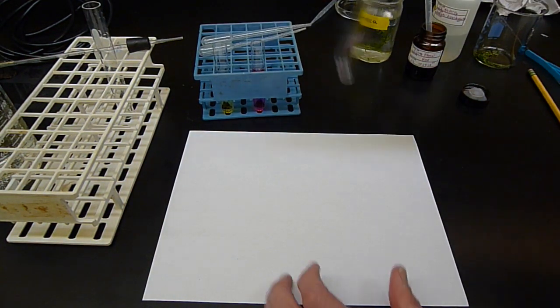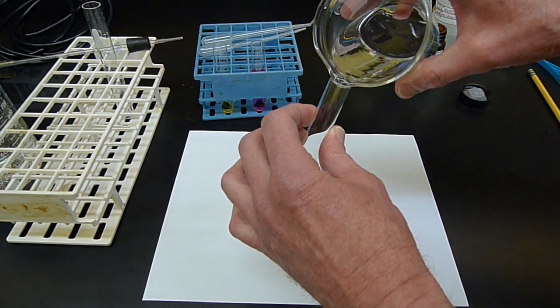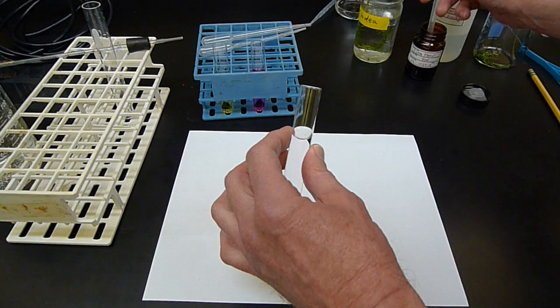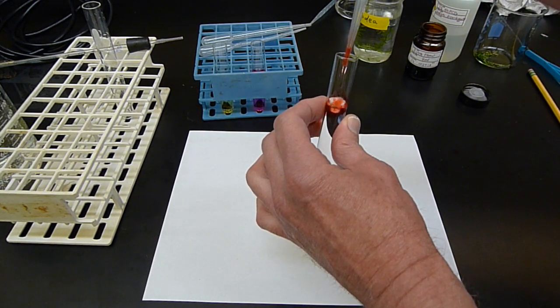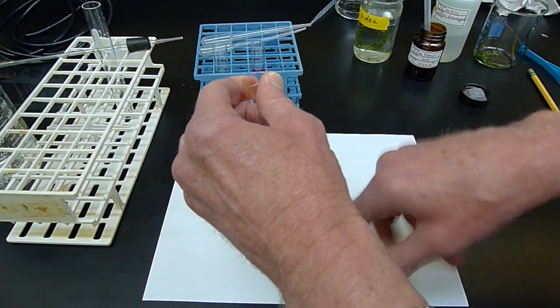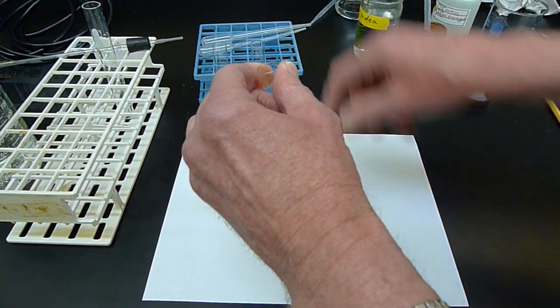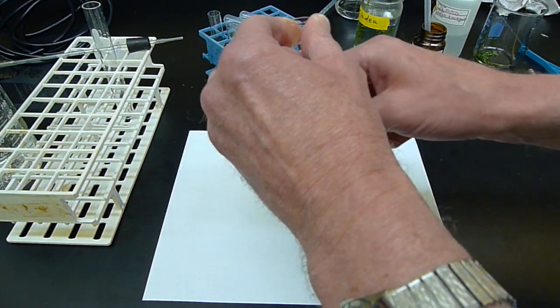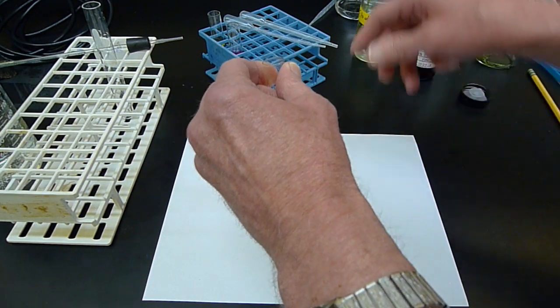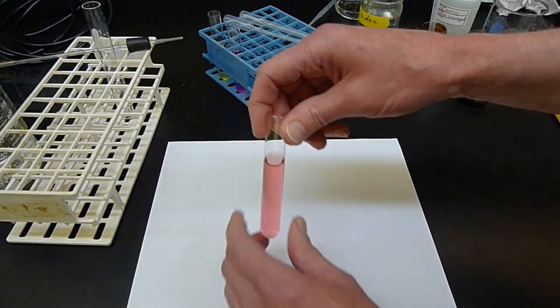Now just to show you what happens with carbon dioxide, here's some tap water. And there's a little drop of dye in there already, but I'm going to put a couple of drops of dye in. Make sure it's red enough. So I'm going to add carbon dioxide to this. Where am I going to get the carbon dioxide, you ask? We all have carbon dioxide, right? We're breathing it out. So all I have to do is breathe on top of this thing. So if I blow my breath on this stuff, it'll change a little bit to yellow. It'll take a few breaths.